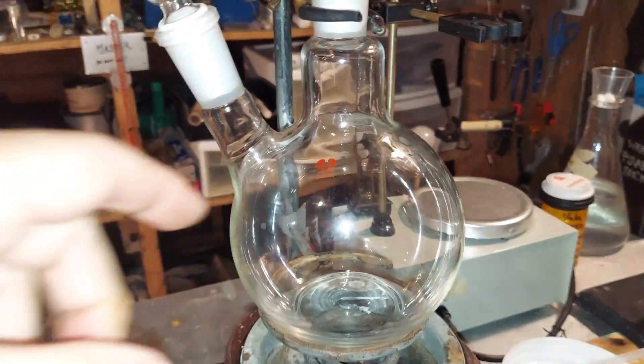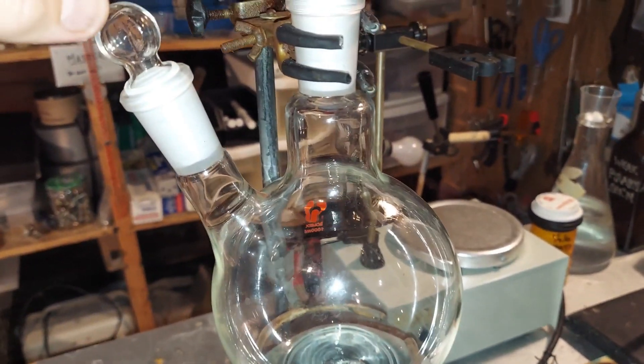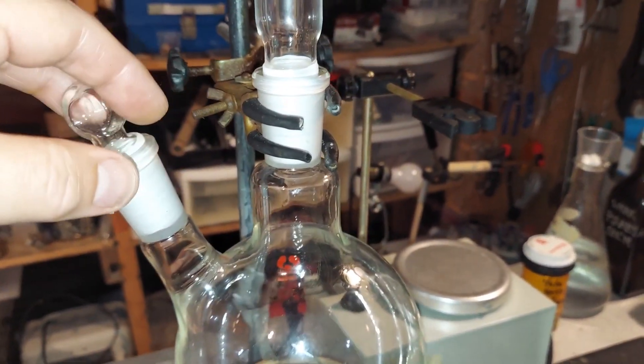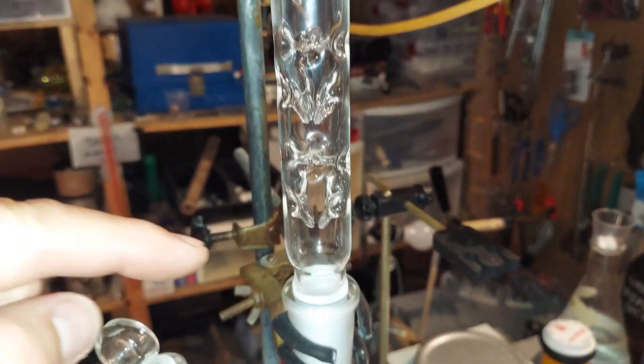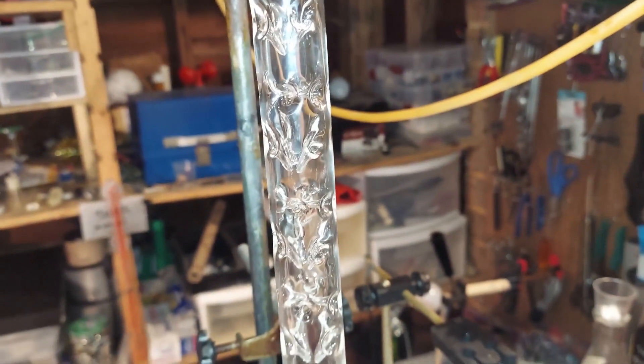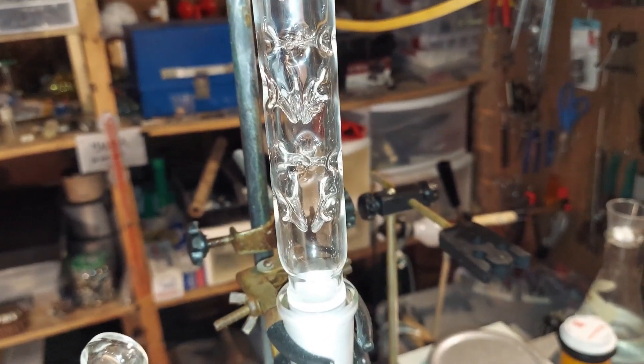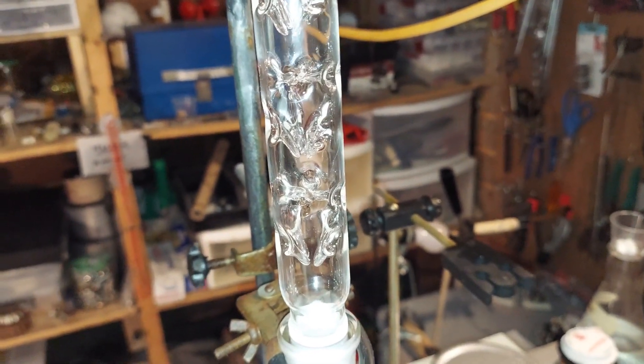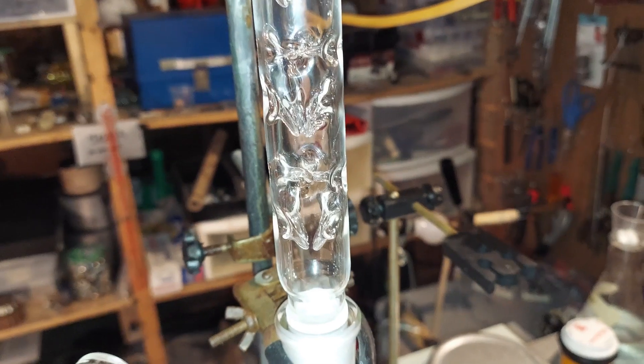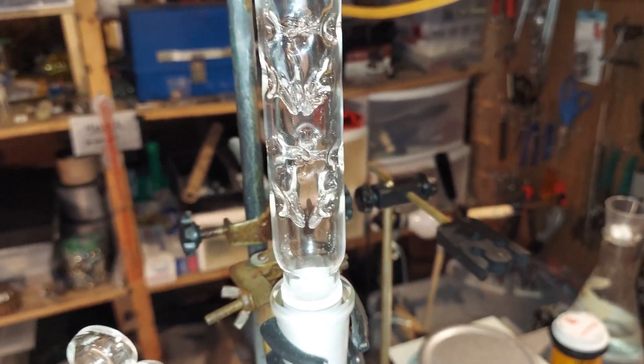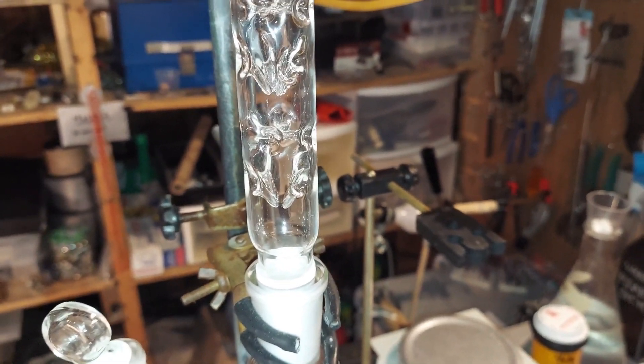So I'm going to pour it inside here. It's a one liter container. As it heats up, the fumes are going to flow up here. Water boils at 100 degrees Celsius, 212 degrees Fahrenheit, and it boils quicker than the nitric acid, which boils at 120 degrees Celsius.